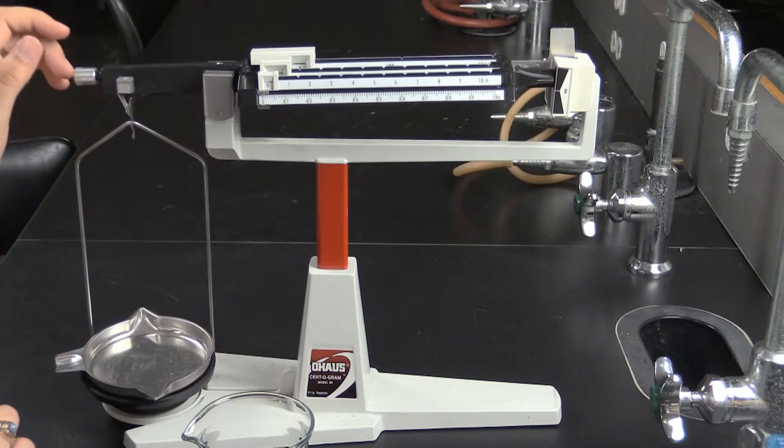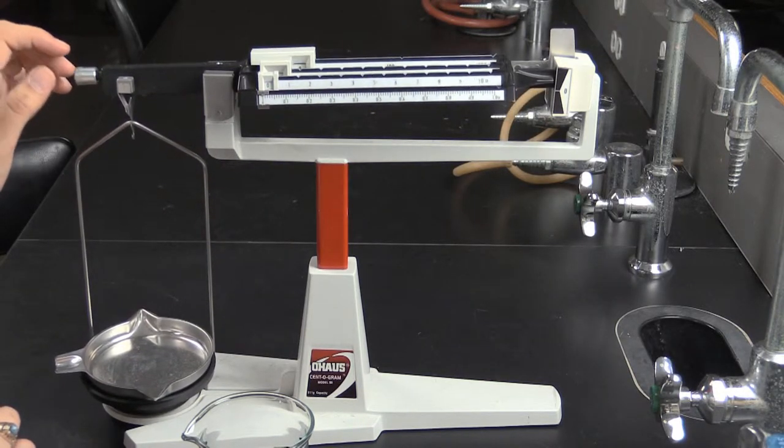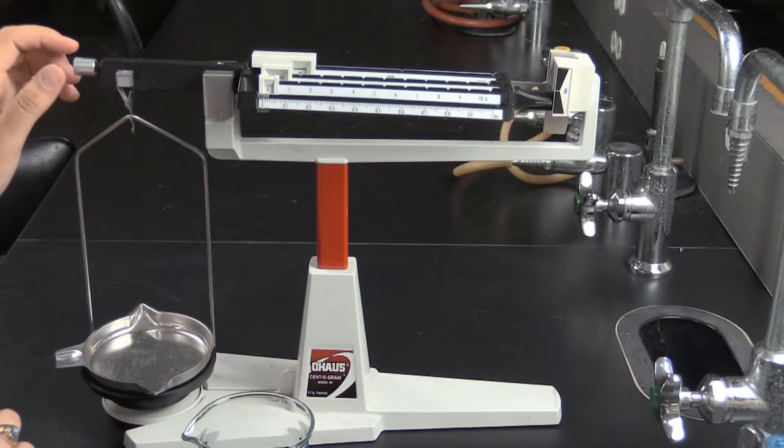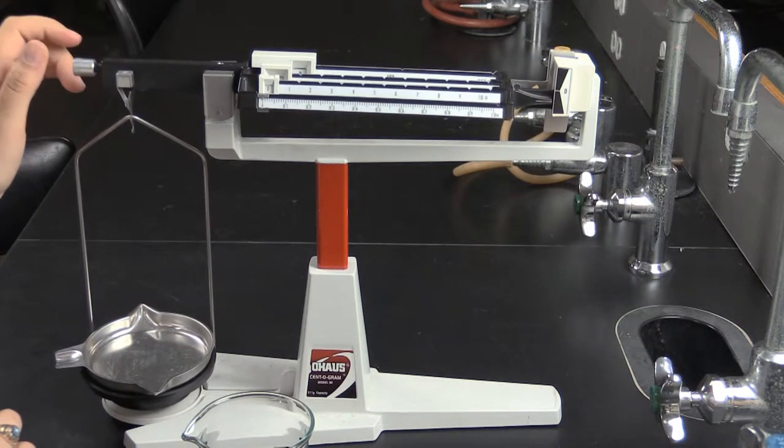Unlike the electronic balance, with the Quad Beam Balance you can see where the name Balance comes from. Like the electronic balance, we must first zero the balance. However, with this style of balance, it will take a bit longer.